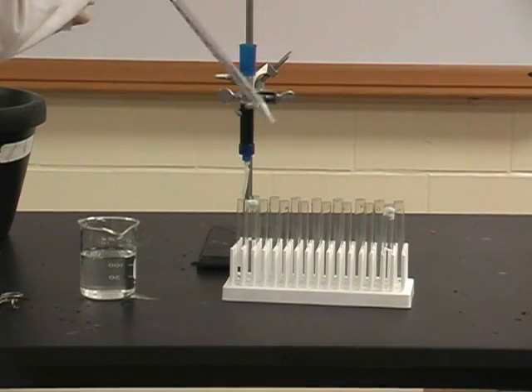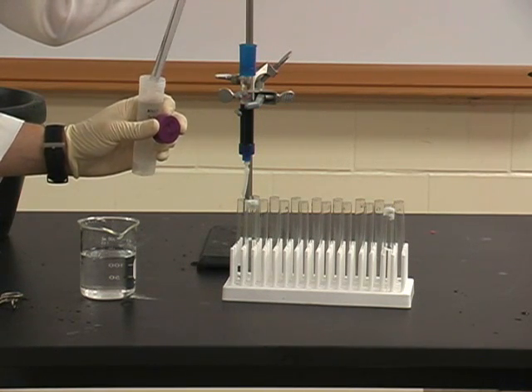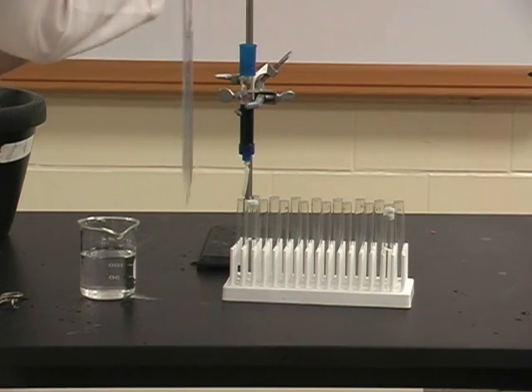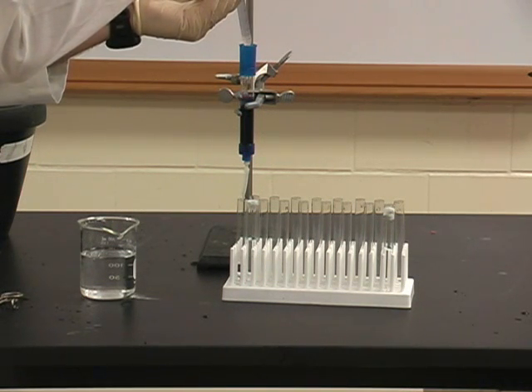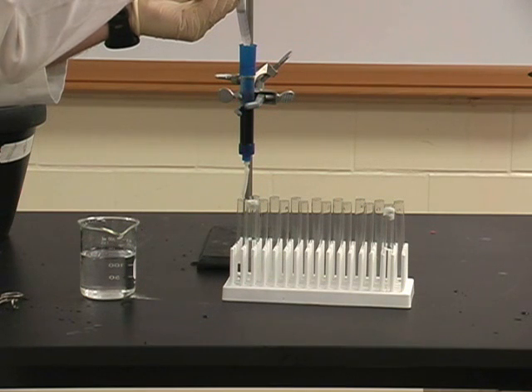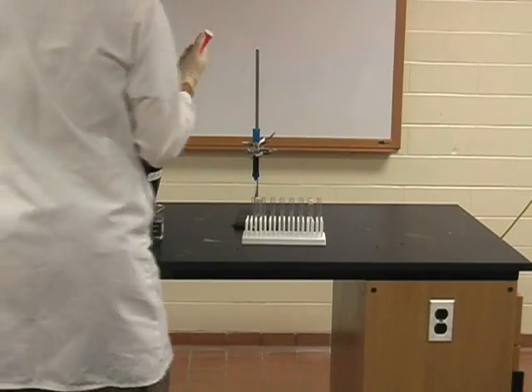Once all of the liquid has been removed, 10ml of NAD wash is placed on the column, being careful not to disturb the top of the column. Again, we will collect fractions until the absorbance at 280 nm falls below 0.1. At this point, we will go to the next step, which is the NADH wash, where we will be removing our LDH from the column.